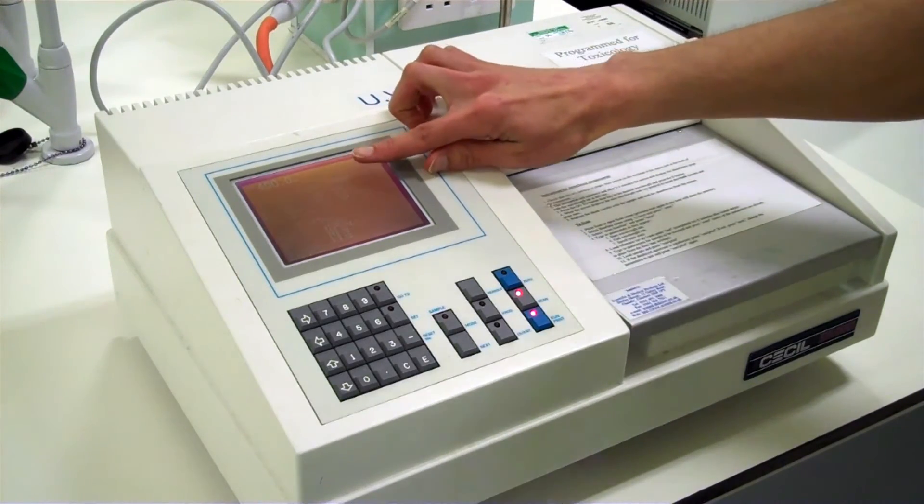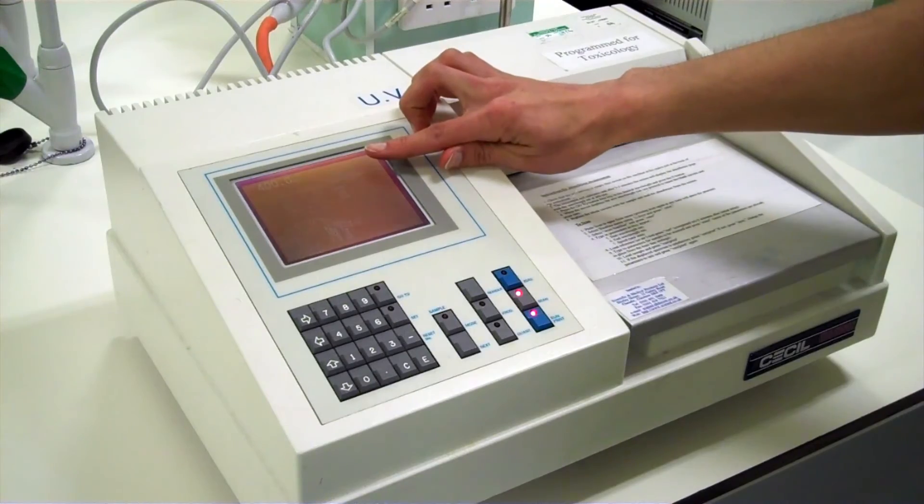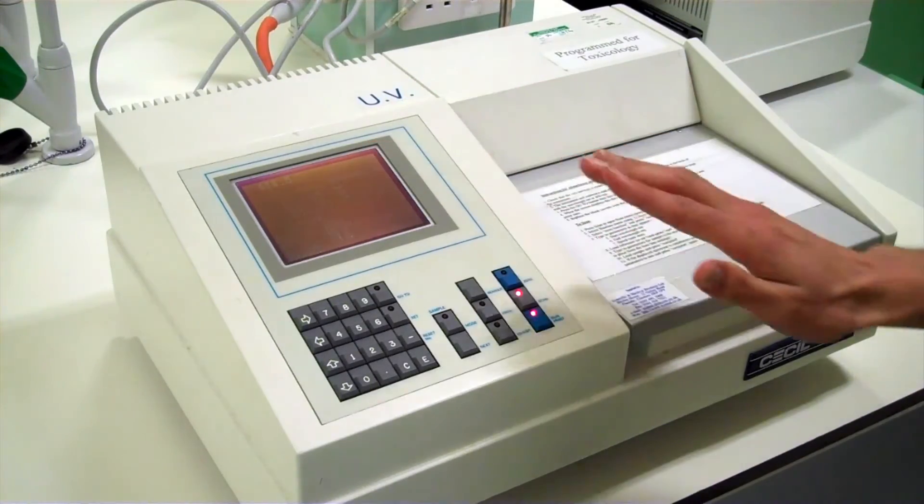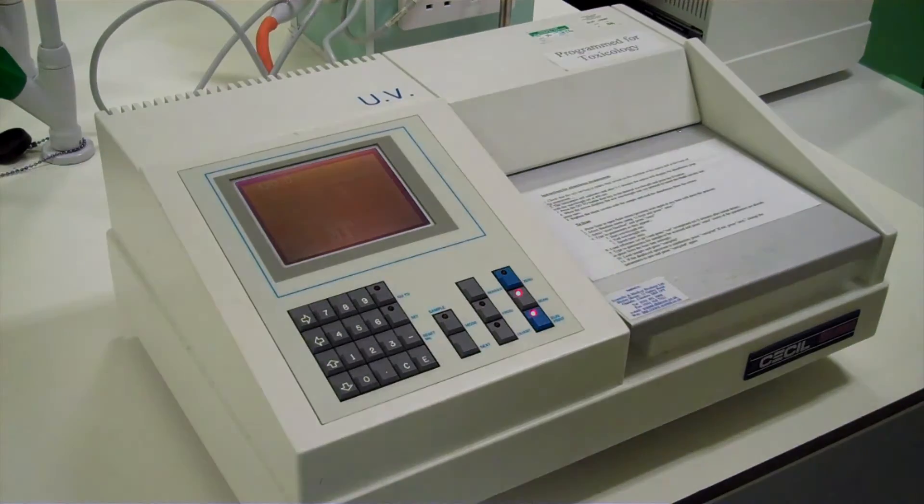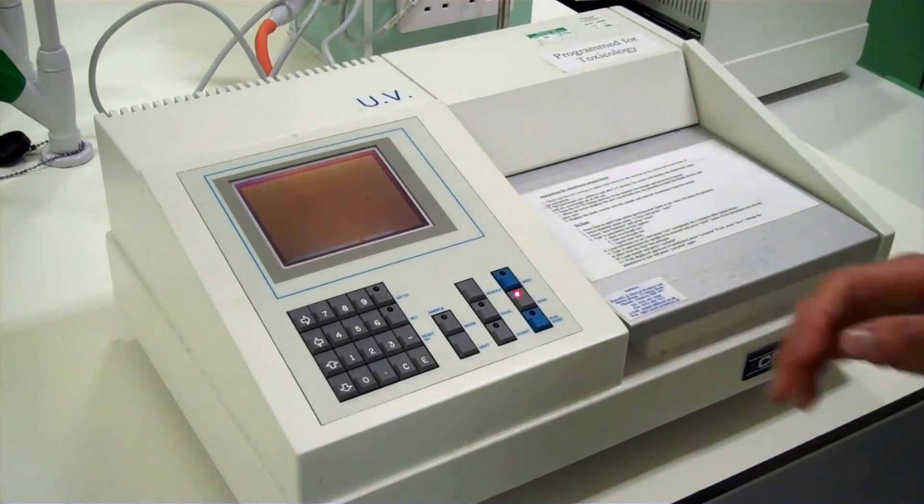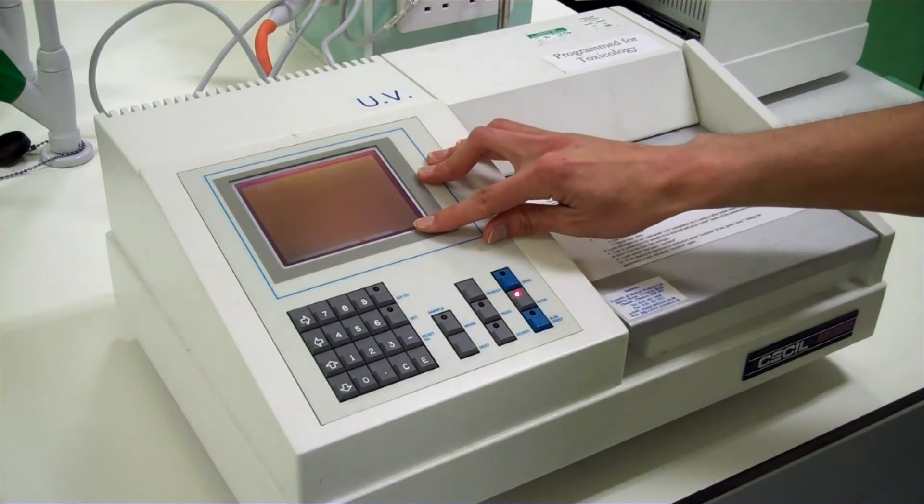Here it shows the wavelengths which are being scanned. It takes a few minutes for all the wavelengths to be scanned so do not panic. When it has finished the baseline will be set for all wavelengths within 400 to 700 nanometers. We then have to type the parameters we want our solution of interest to be scanned at.